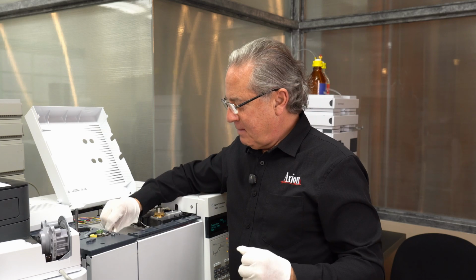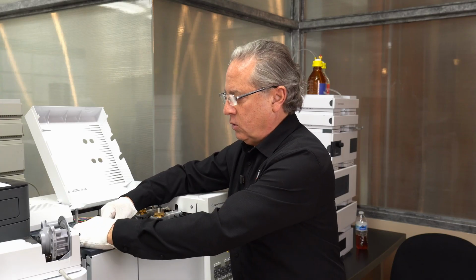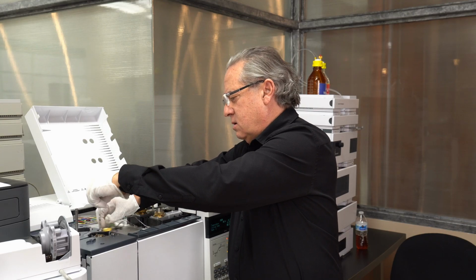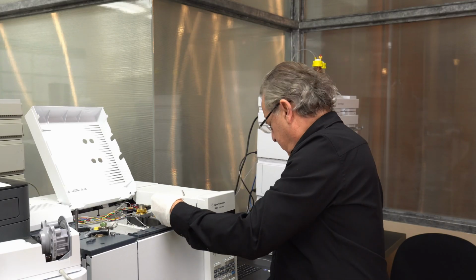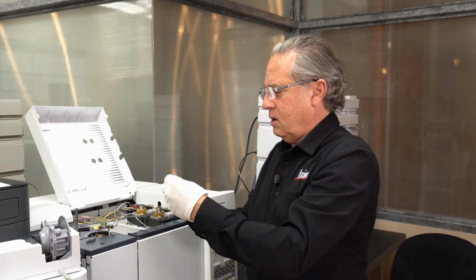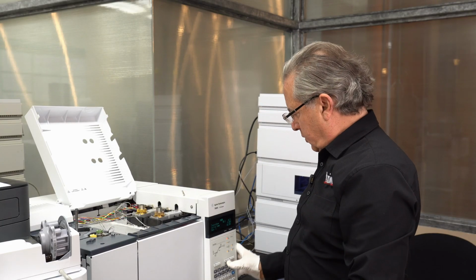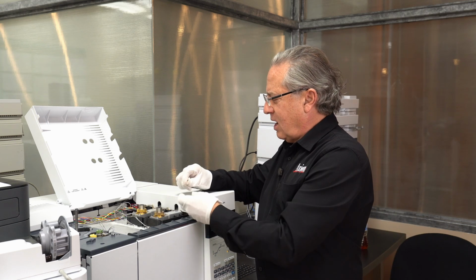So my next step is to open this up. There's a little slider, and I'm going to slide this open, pull this guy out, and here we can see our old liner, and now I'm going to pop a new one in. Put on a new O-ring. So I'm going to drop a new one in. Go back here. There we go. So it was only down without flow for a few seconds, and the temperature's not terribly hot.